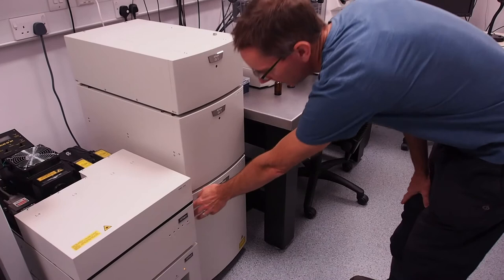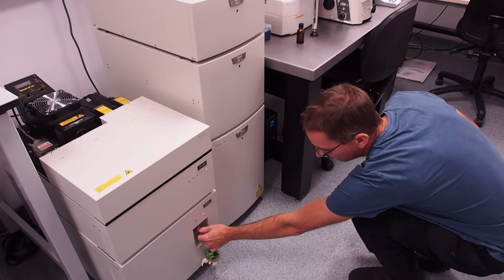On the left of the microscope switch on the scan head using the button on the left of the electronics stack and turn the key on the laser bed to power up the lasers.